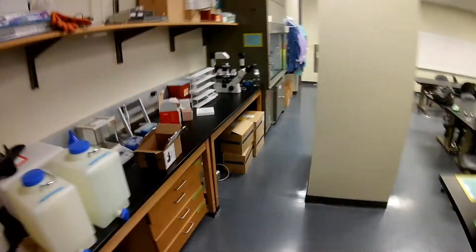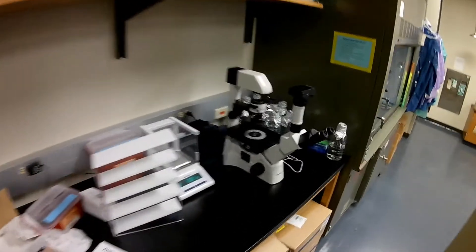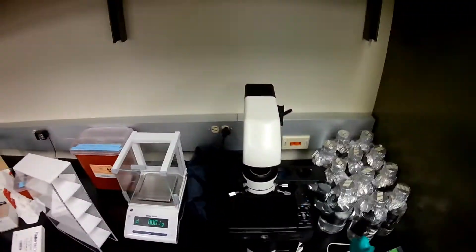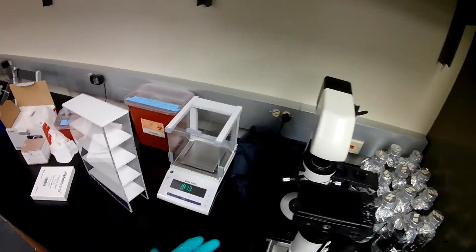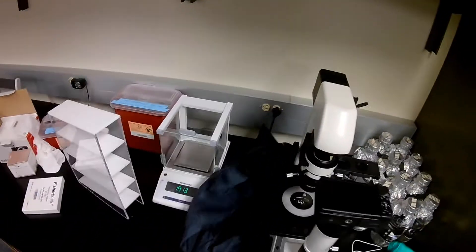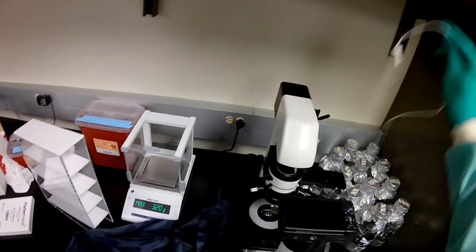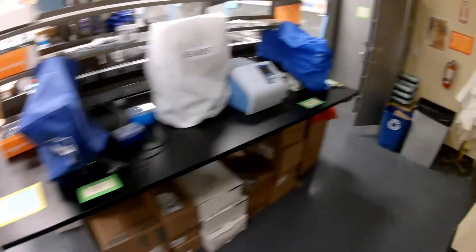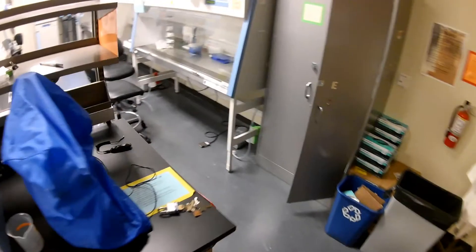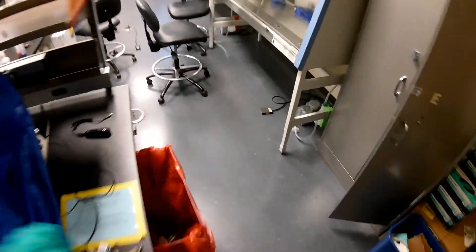And the last thing is to make sure the microscope gets put away nicely. If you were going to need to record to retrieve the video, which I'm going to do in a second, you would get out the memory card or hook it up using USB. But we really want to make sure the microscope is covered. That keeps all the dust out. And we're good. We are done cleaning up. So today was a very short day in lab because I just needed to feed cells. Feeding cells is very easy. It gets to be a little tedious once you get used to doing it.